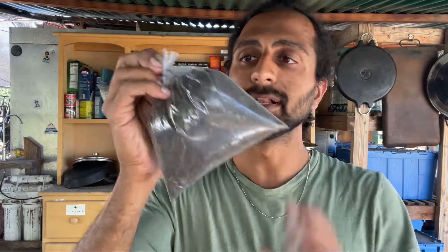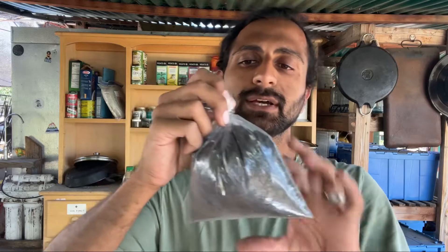So two to three cups — that's maybe half of this bag that I'm going to fill up. And that's it, that's my sample. I'm just going to put this in a box and ship it off. I'm going to get the standard agricultural suitability test from Wallace Labs. They just updated the pricing — it's $90 per test. Well worth it, especially if you're gardening in a city and you might have lead in your soil. You really don't want to be breathing or eating lead.